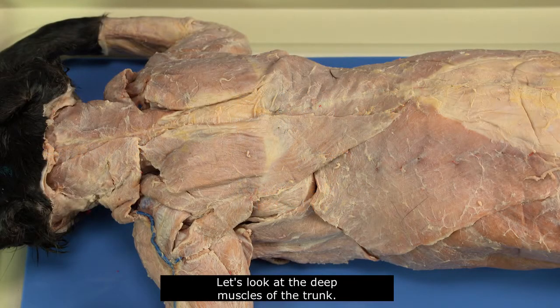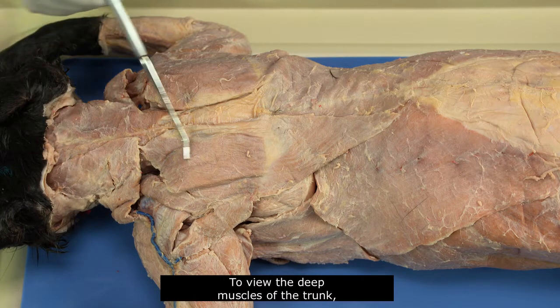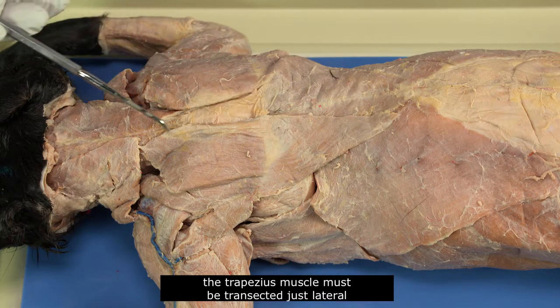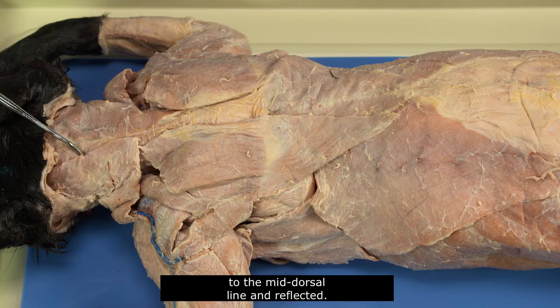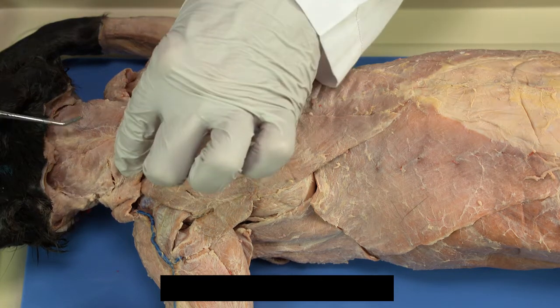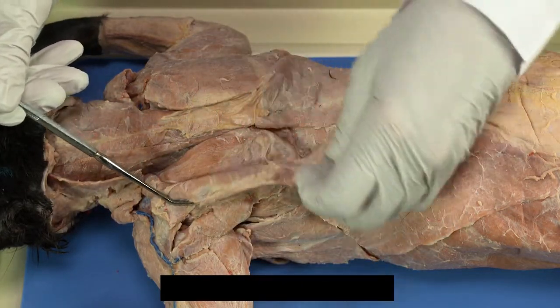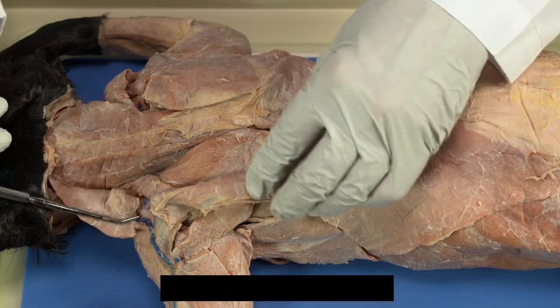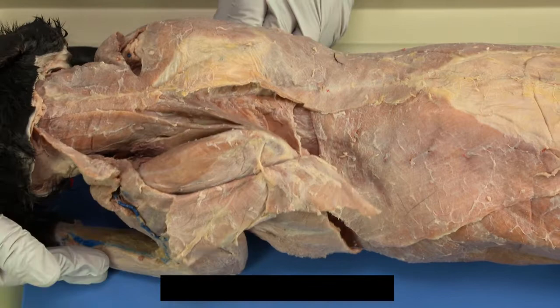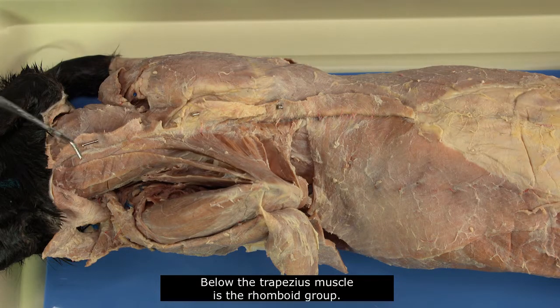Let's look at the deep muscles of the trunk. To view the deep muscles of the trunk, the trapezius muscle must be transected just lateral to the mid-dorsal line and reflected. Below the trapezius muscle is the rhomboid group.